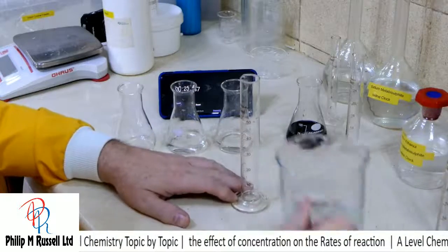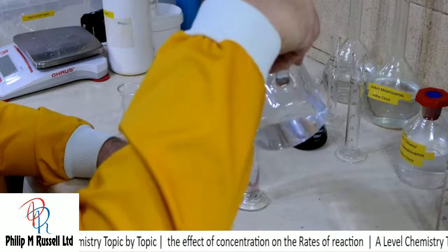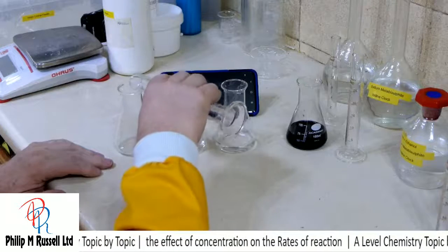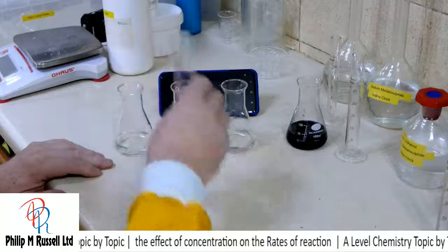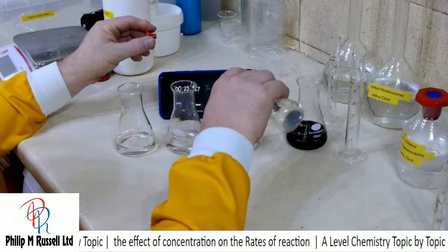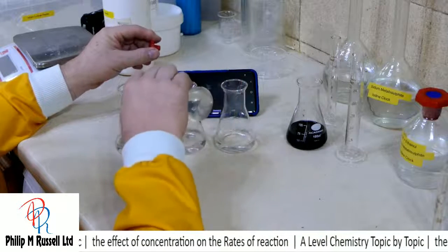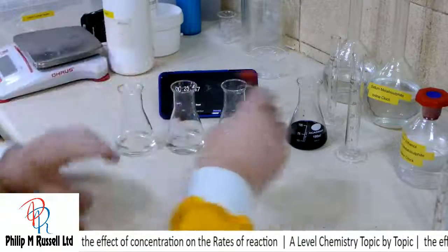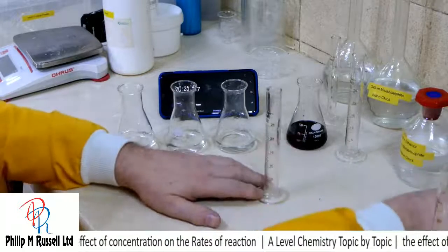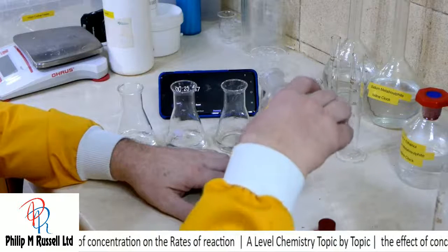And we'll do one with 30. So I've just got different amounts of water in. We're just going to put a little dollop of indicator in to each one. It's only an indicator, so it doesn't matter the amounts. And we're going to put in to each of these 10 of the potassium iodate.